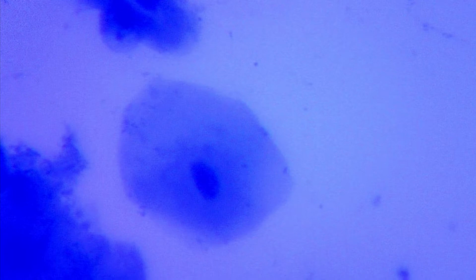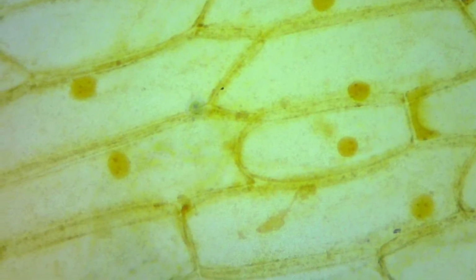You are now ready to report your observations. Take out your biology notebook. This is labeled as Session 4 Lab, the human cheek cell. The cheek cell is unicellular, one cell only. Select one of your cheek cells that looks like the one I have in the picture. Using the onion cell, compare it to the human cheek cell. Let me remind you what an epithelial onion cell membrane looks like.